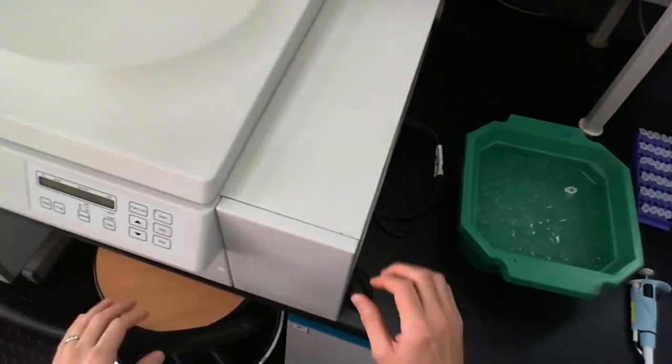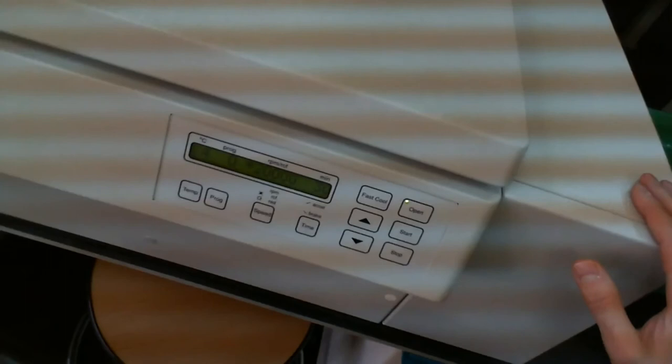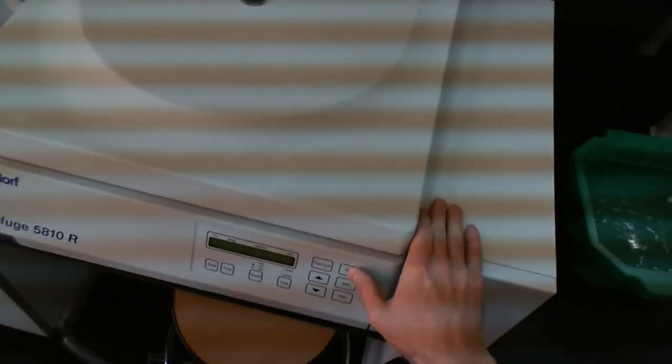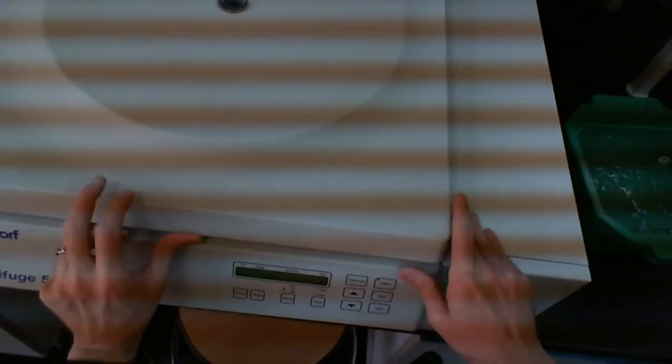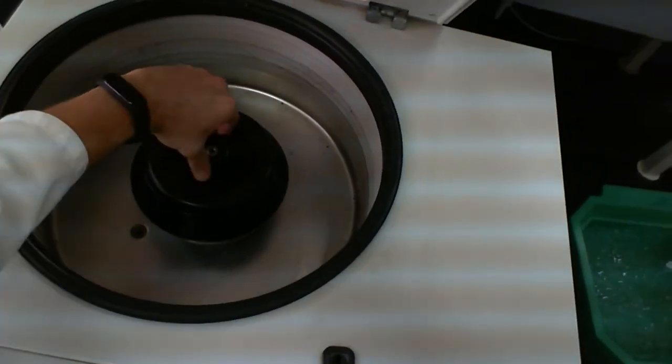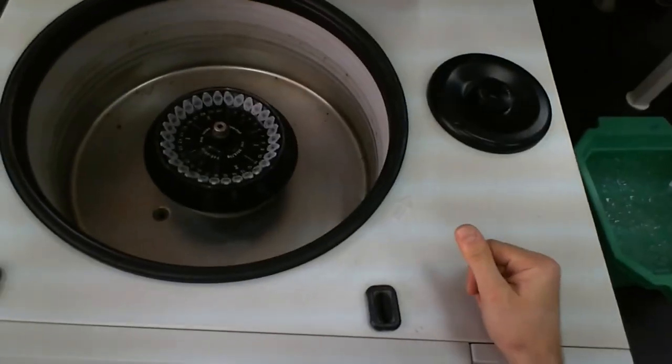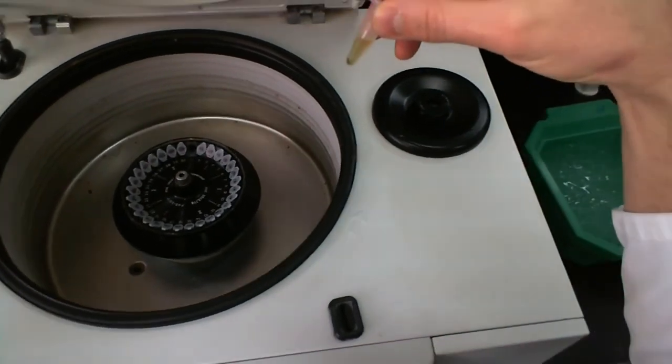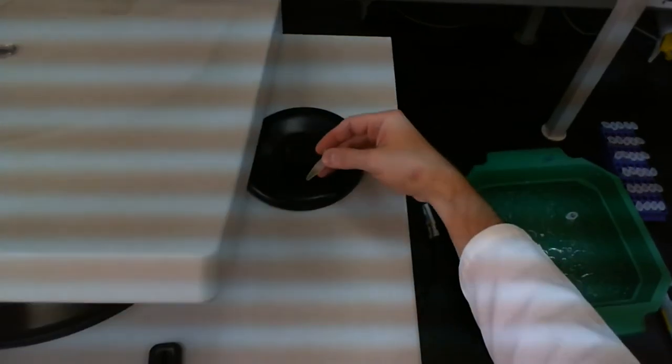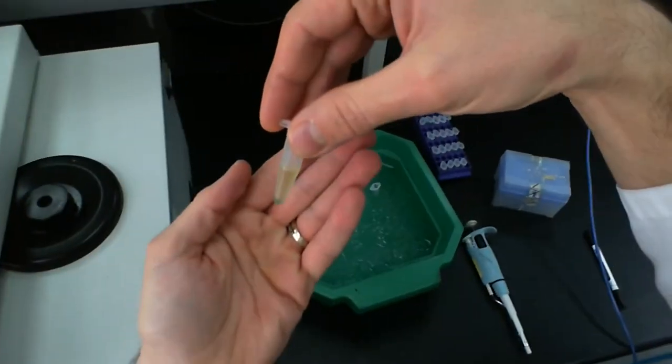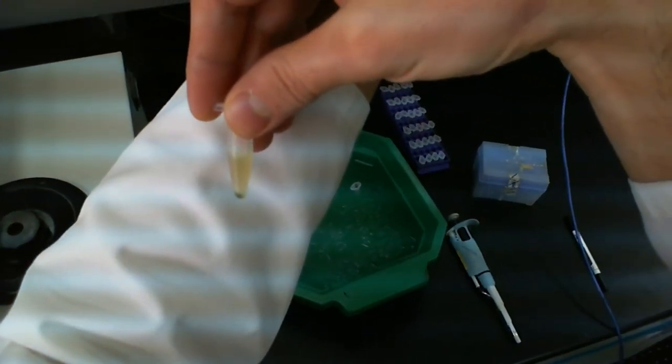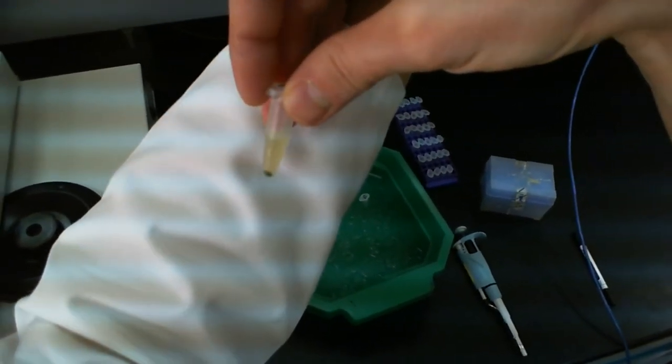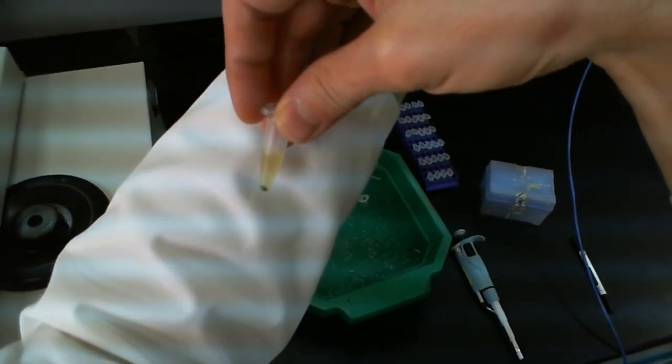Here we are. Our centrifugation has just finished. So this was the half hour centrifugation at 20,000 RCF. So this is the RCF with a star at 4 degrees Celsius. I'm going to open up our centrifuge. And so if we open this up, these are the samples that I was spinning. You guys will be spinning fewer samples than this. Let's take a look at one of them. They're all the same. So I want you guys to notice that there is a green pellet at the bottom. And the solution above it is just kind of a light green color. But most of the green color seems to be in the pellet. So why do you think that is? What would make the pellet green?